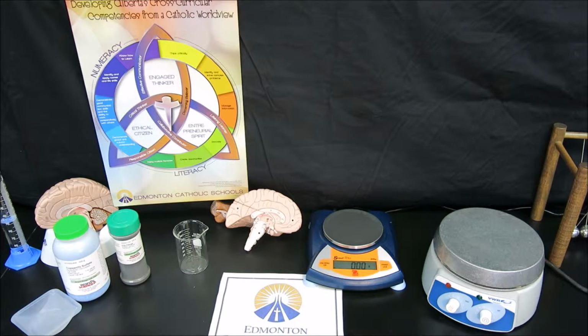By measuring the mass of the original iron and copper-2 sulfate that we use, and then measuring the mass of the final product of the copper, we can determine the percent yield for this reaction, or alternatively the percent error for the predicted mass of the product.